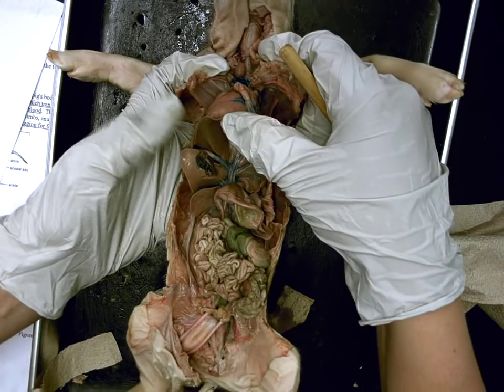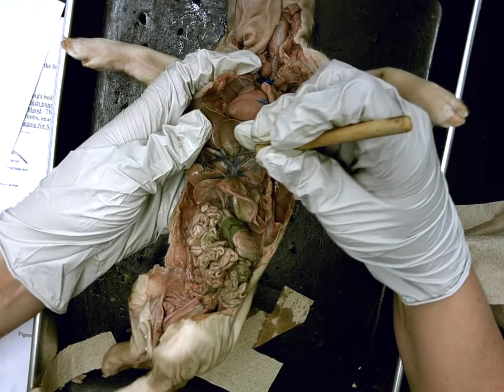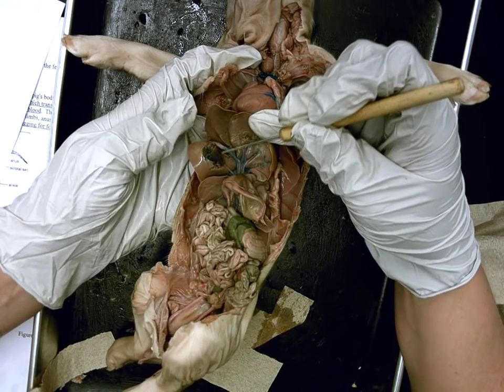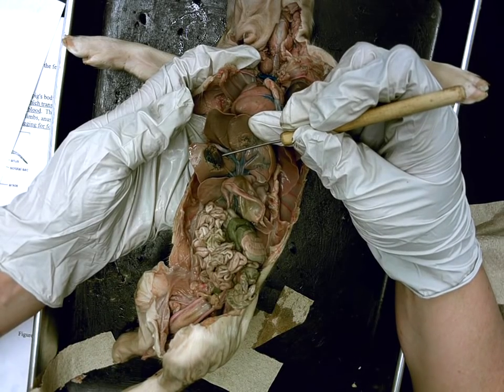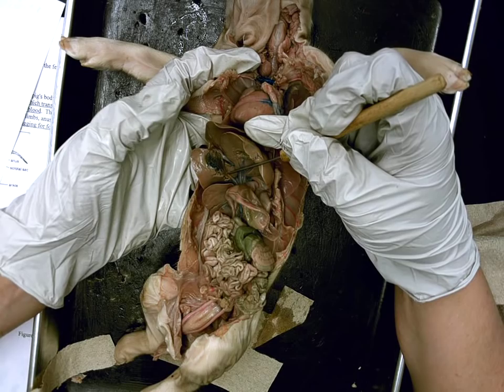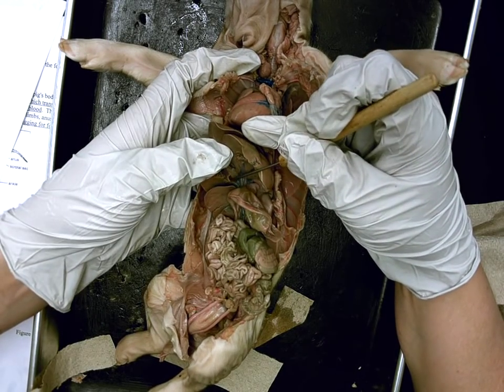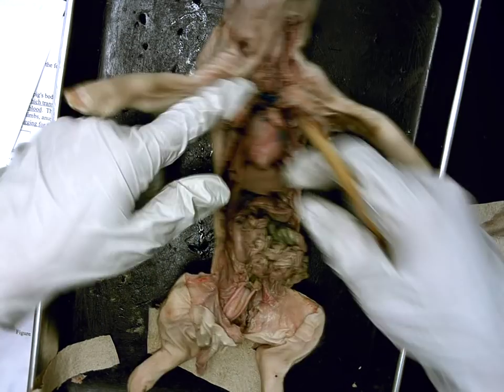If I pick up the liver — again, the video is nicer than what we can see up here — there's this little green balloon on the base lobe of the liver. Melissa, what would this little green balloon be? Gallbladder. Function of the gallbladder? Stores bile. Coming down from it is a narrow tube. What do we call the tube, Adriana? The bile duct, and its job is to drain bile into the duodenum. Correct, and you said it perfectly.